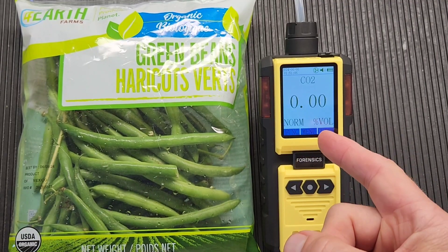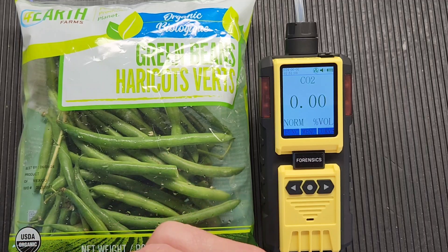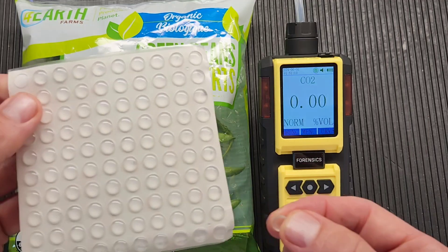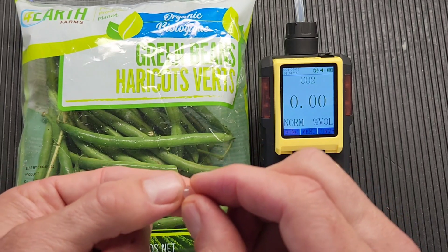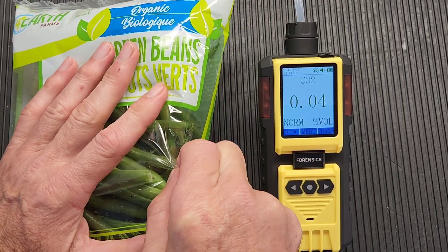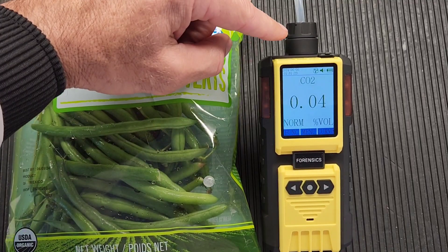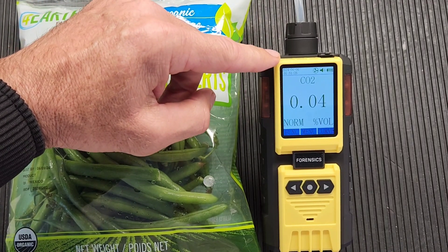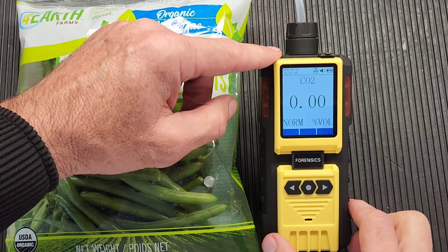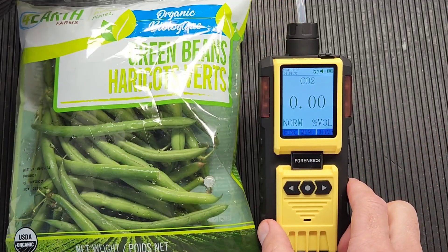We're going to do a quick test on green beans. Here we are, folks — we have the carbon dioxide headspace analyzer. We have green beans that have been flushed. Take one septa and make sure you pop it on nicely, ensuring it adheres very strongly onto the packaging. The unit is operating and the pump is on — it turns on once you start up the unit. No more buttons are needed after that. The tubing is connected.